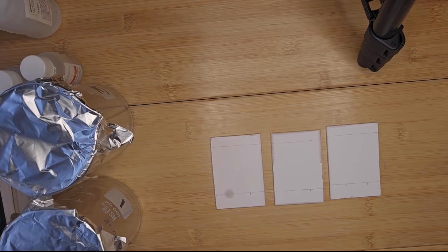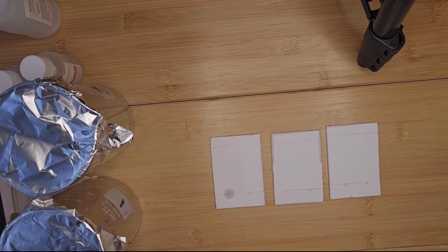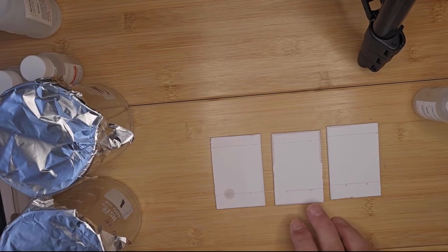So I'm going to apply just 3 small drops to the application line. Okay, that's plenty. It's rather bigger than I would like, so if you can make the application circle a little bit smaller, that'd be great. So that's the first standard. Now I'm going to apply my other standards, and then lastly, I'm going to apply my sample to each plate.